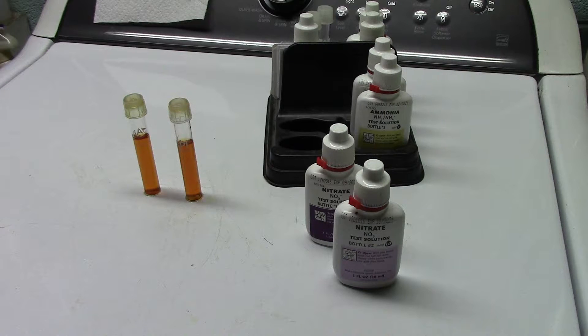And we're going to let them bloom side by side, and I'm going to bet we get exactly the same color. Because I've done this a million times way back in the day, I tested by doing exactly this just to find out if you really did need to shake that thing vigorously for a minute, or if like I said in my previous video, you simply needed to make sure that stuff stayed in suspension for a good 15, 20, 30 seconds maybe.